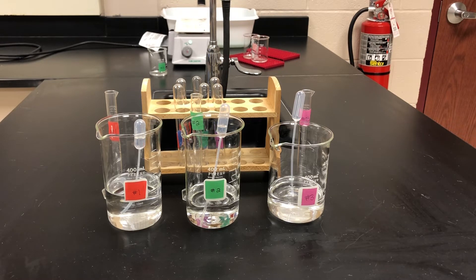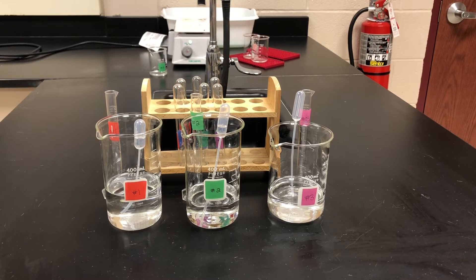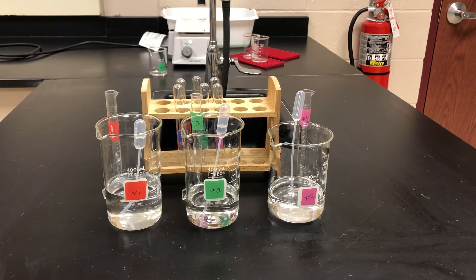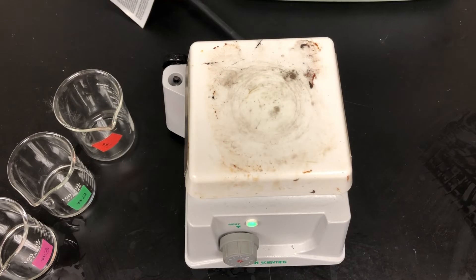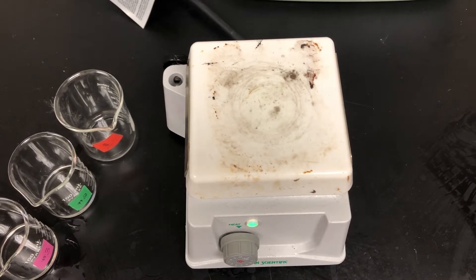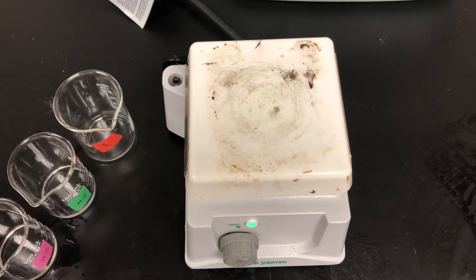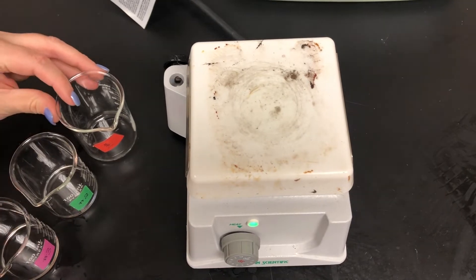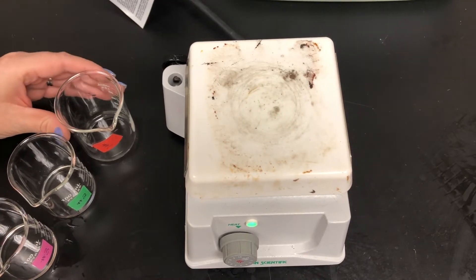We will start with the boiling point experiment. Please record your observations in the data table for the various liquids. We will begin our first boiling point experiment and we will place all three liquids on the hot plate at the same time and observe which one boils first, second, and third.